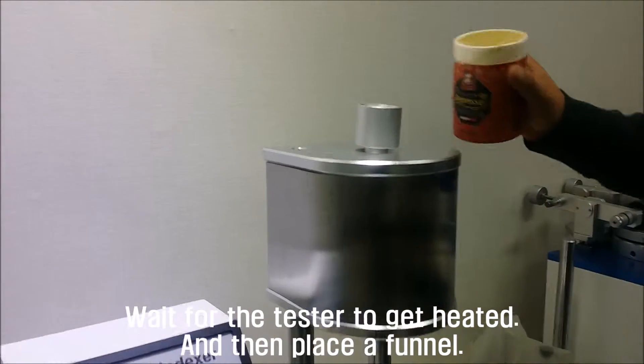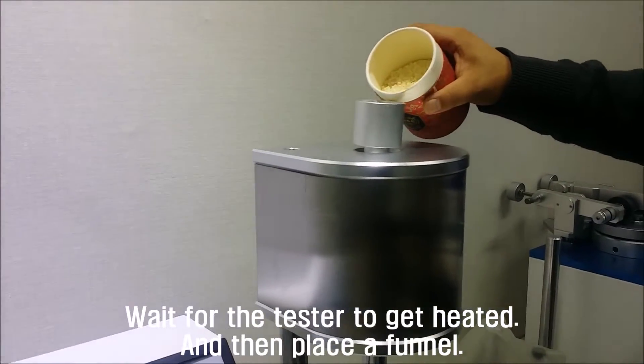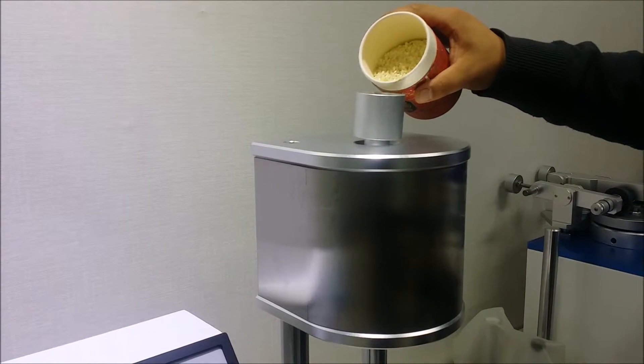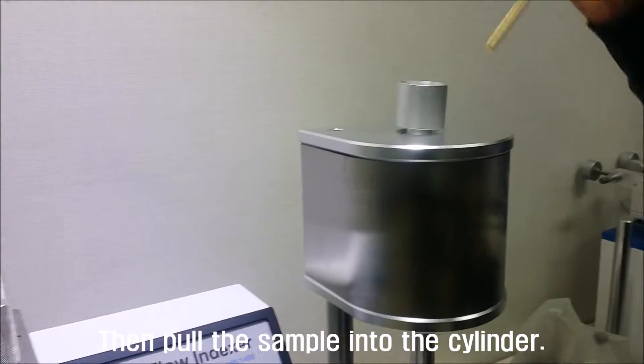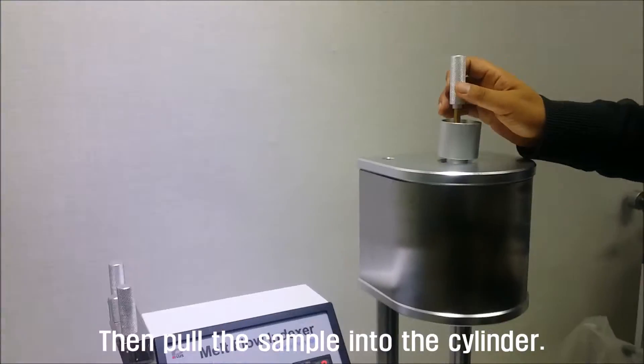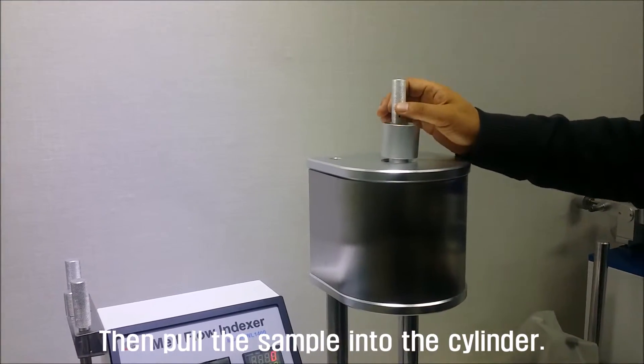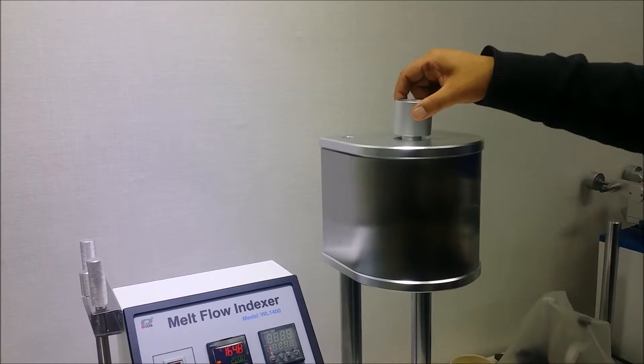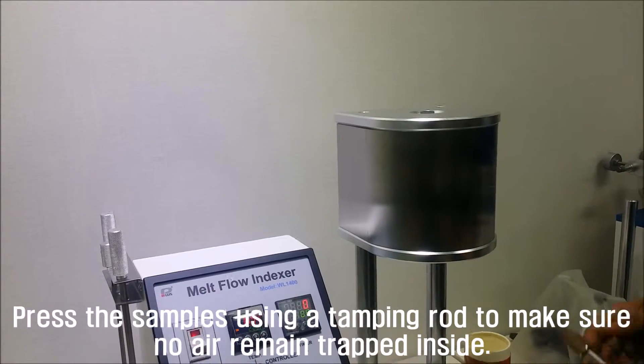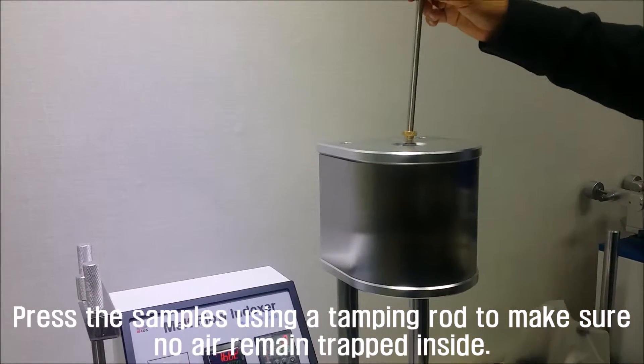Place the funnel, then pour the sample into the cylinder. Press the samples using a tamping rod to make sure no air remains trapped inside.